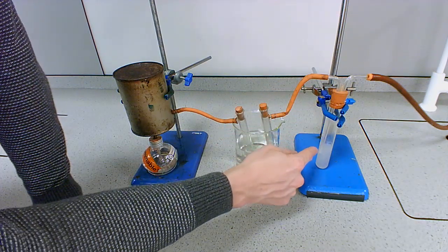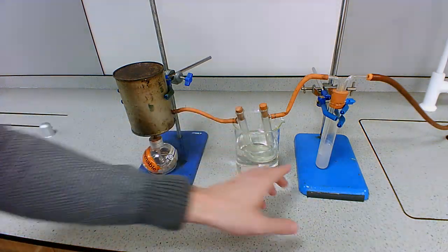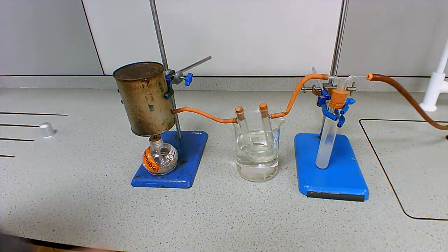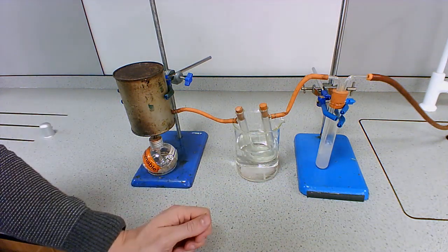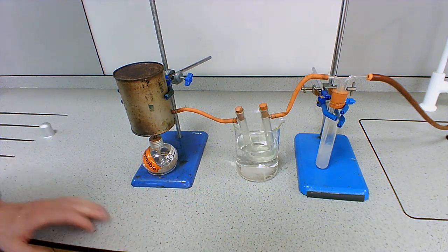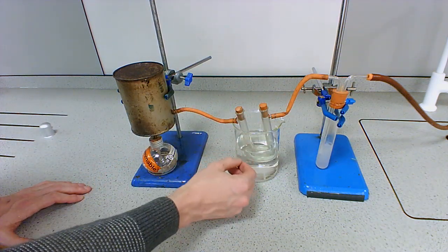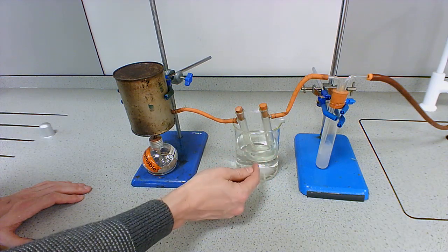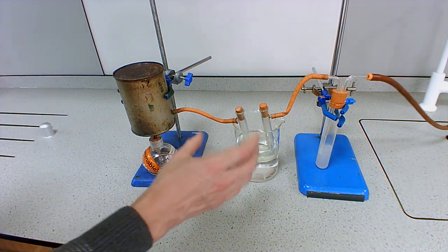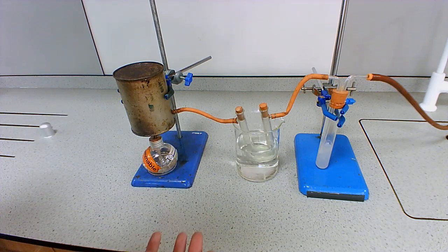And what we have here is lime water. You can see here, already, in the time it's taken me to talk to this point, it's already turning cloudy. We should be familiar that the test for carbon dioxide is to bubble it through lime water, and if it turns cloudy, then that is the positive test for carbon dioxide. So what we've proven is that by collecting the water vapor here, which condenses and turns the cobalt chloride powder pink, we prove the presence of water vapor, and by the lime water turning cloudy, we prove the presence of carbon dioxide.